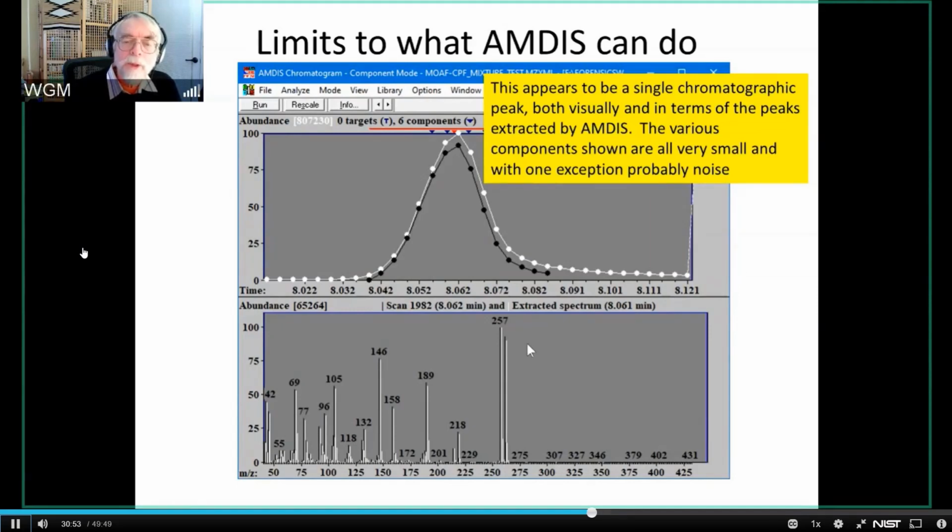So this really does appear to be a single chromatographic component, both visually and in terms of what AMDIS is showing. AMDIS is showing some other little things here, but they're all very tiny things that are mostly noise. But this is the scan that really represents essentially all of this data, except a little background.